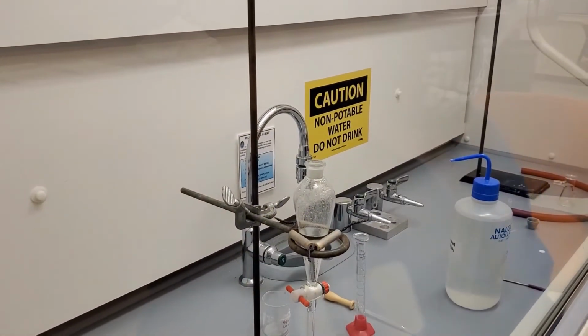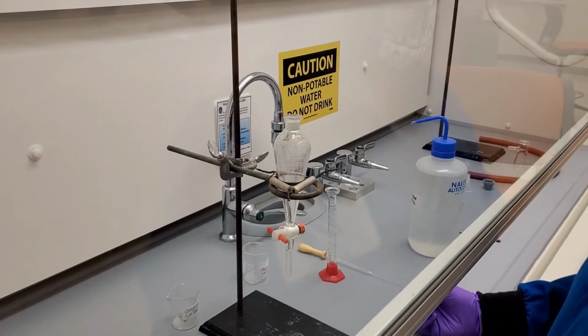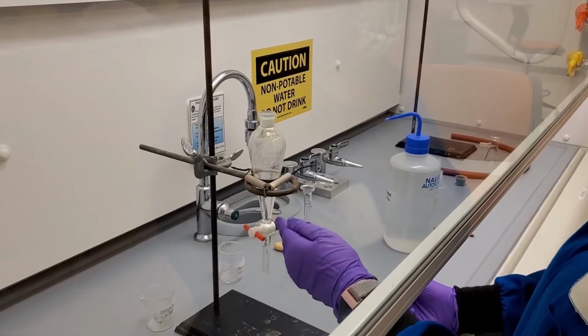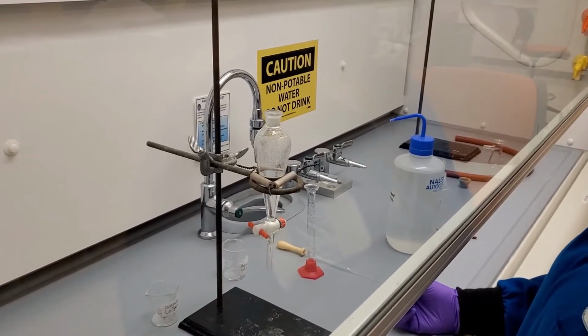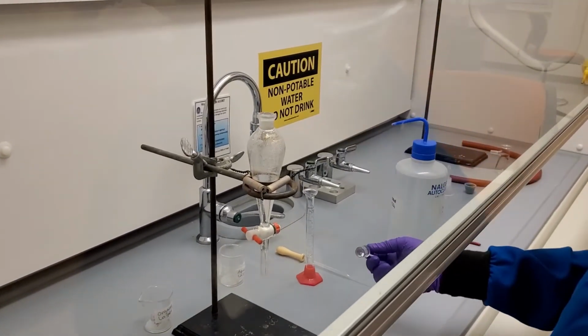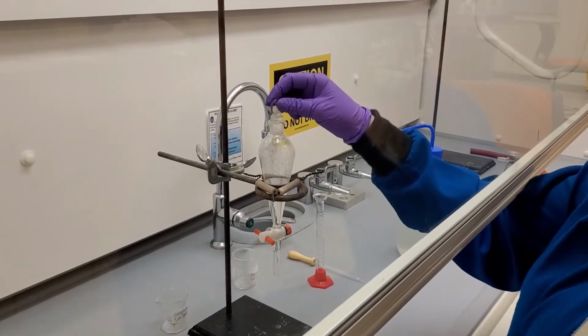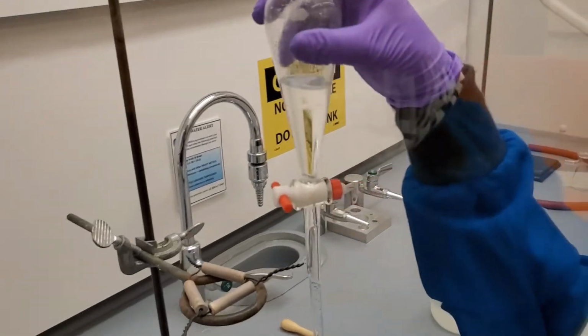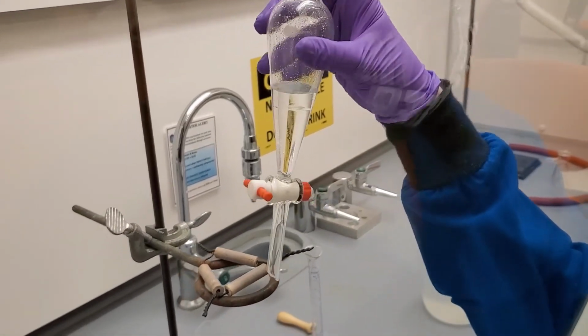We slowly and carefully remove the stopper so that the gas can vent from the reaction of bicarbonate with salicylic acid. We restopper the flask, remove it from the ring stand, and notice that the layers have separated themselves. We repeat the shaking and venting 2 more times to ensure that the solvents have thoroughly mixed.